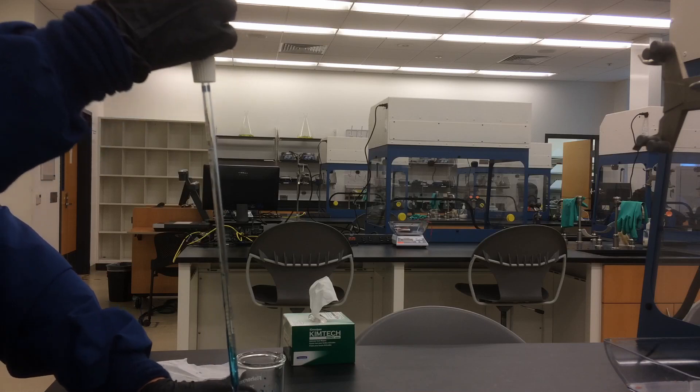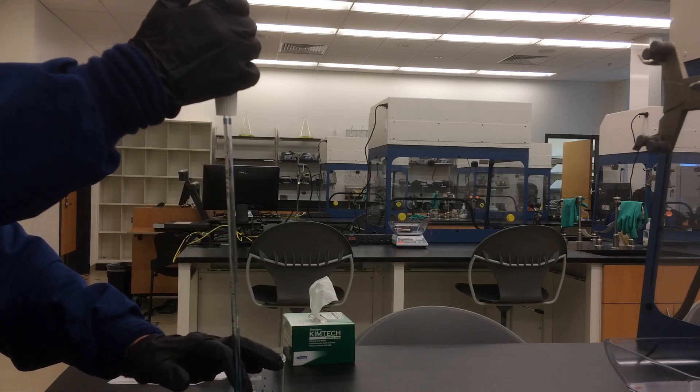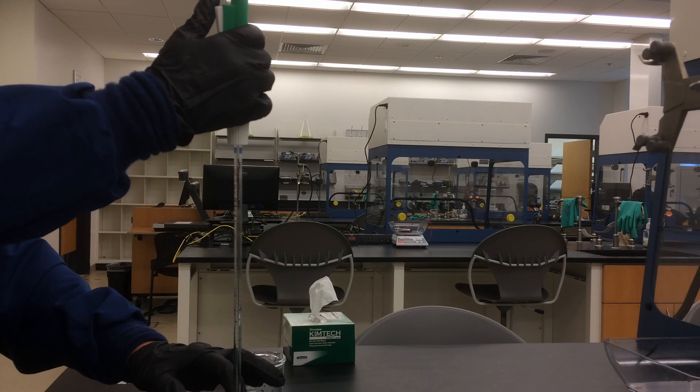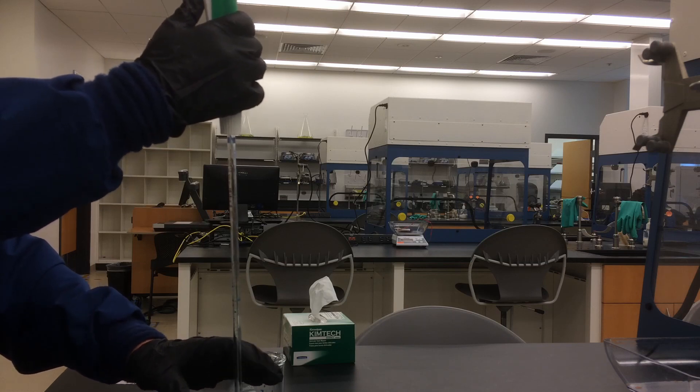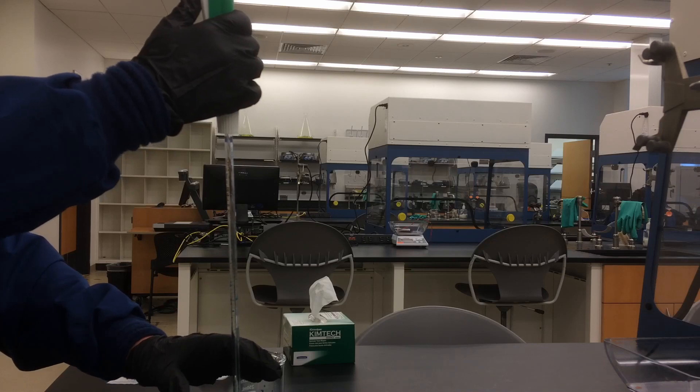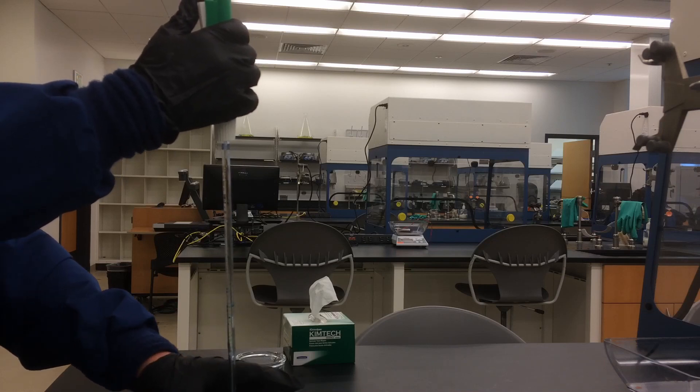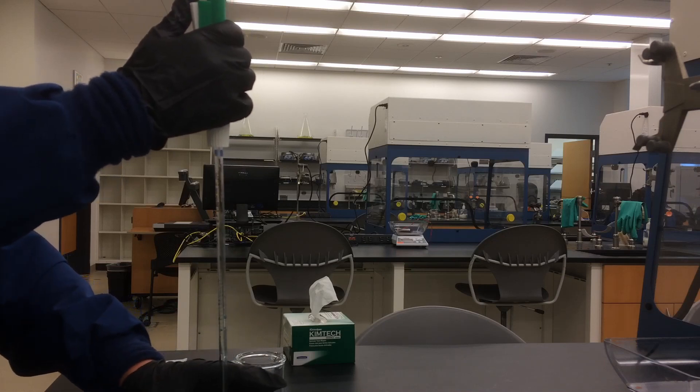There is a last drop of liquid in the tip of the pipette. As I mentioned before, don't force it out, leave it there.